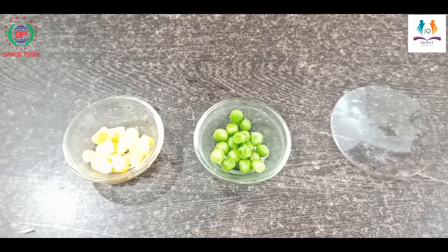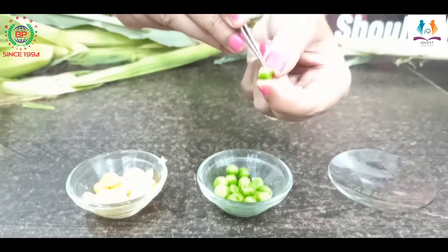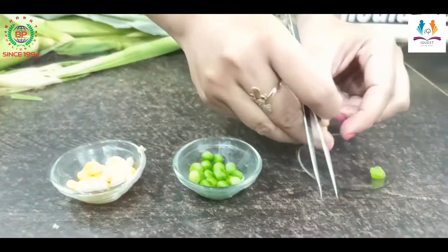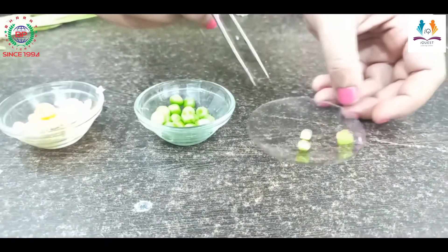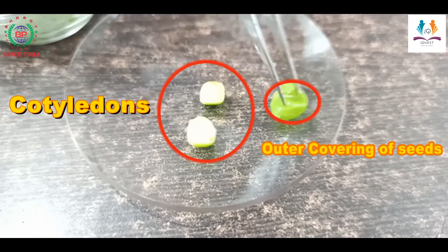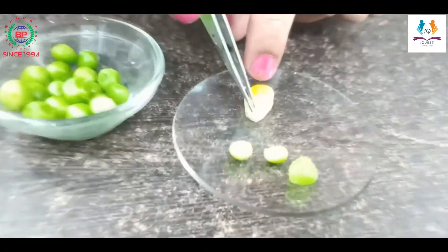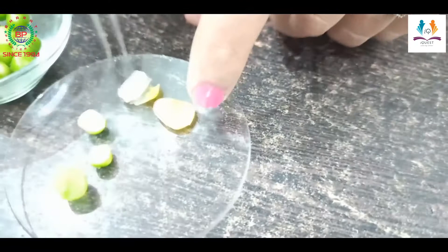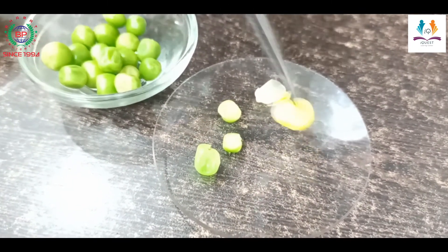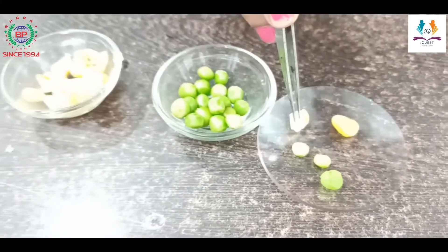Now we will discuss the monocot and dicot seed. These are the maize seeds. For the pea plant, I removed the outer covering and you can see two cotyledons — these are the cotyledons of the pea plant. This is a dicot seed. Now for the monocot maize seed — this is the outer seed coat — and this is the single cotyledon of maize. Here you can see only one cotyledon, whereas two cotyledons were present in the pea plant. This is the basic difference between monocot and dicot.